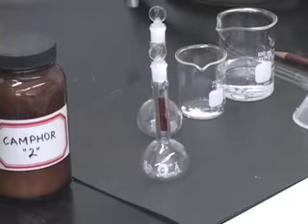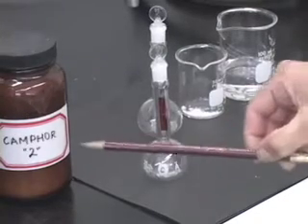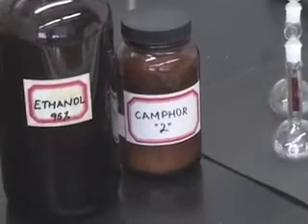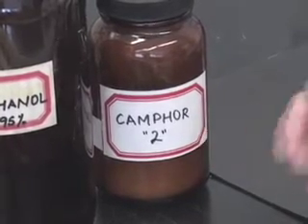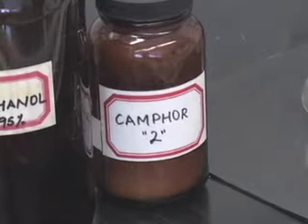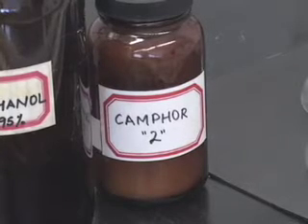I'm going to show you the preparation of camphor solution. You will follow the same procedure to prepare the solution of product. As you notice, this camphor is labeled camphor 2. You might have used camphor 1 in your experiment. If you used camphor 1 in your experiment, then you would use camphor 1 to prepare the camphor solution.